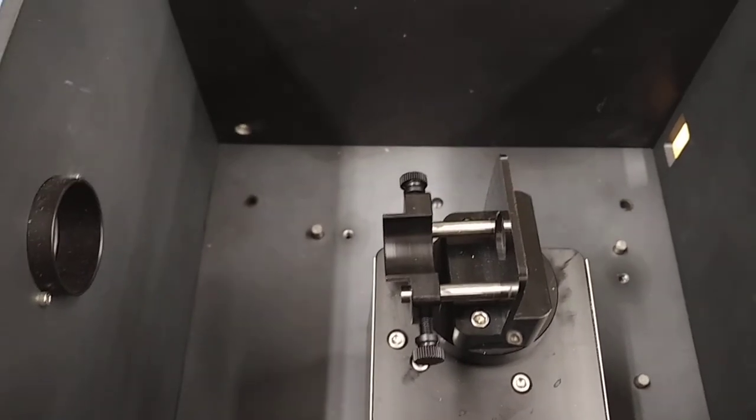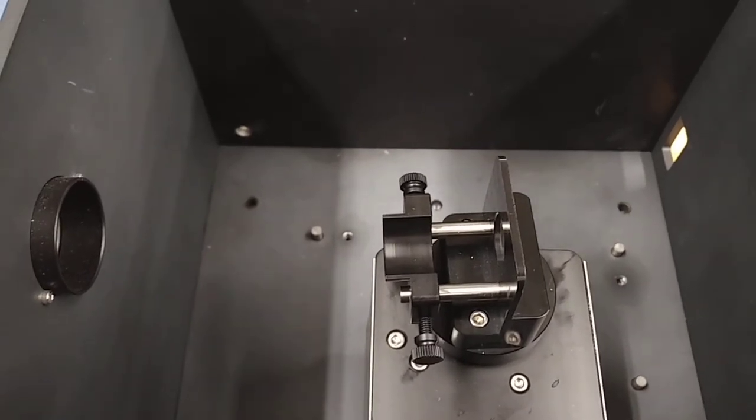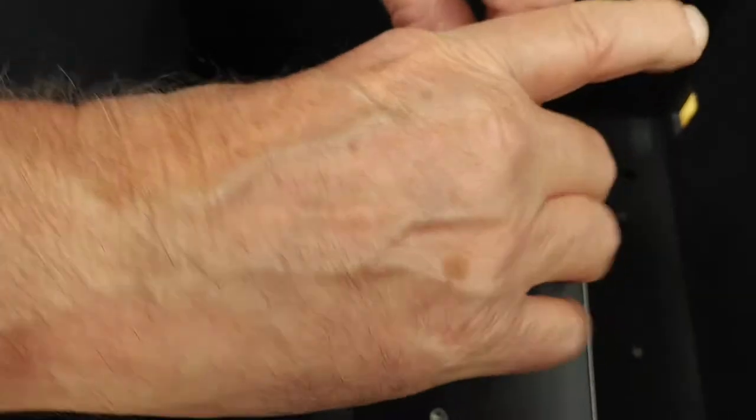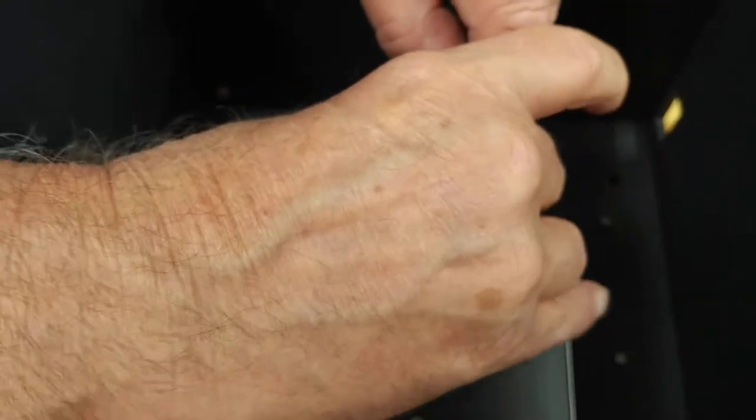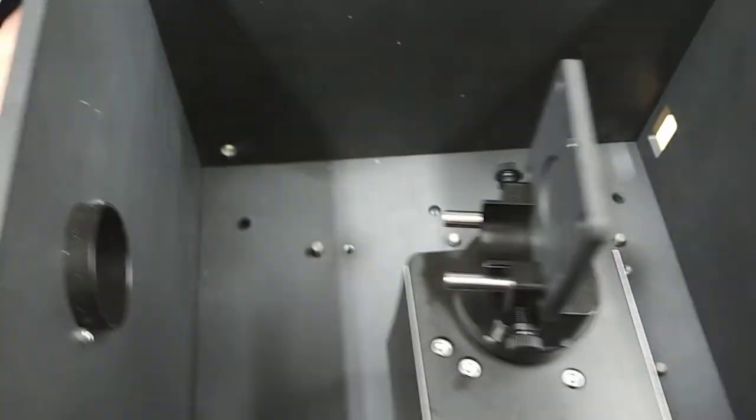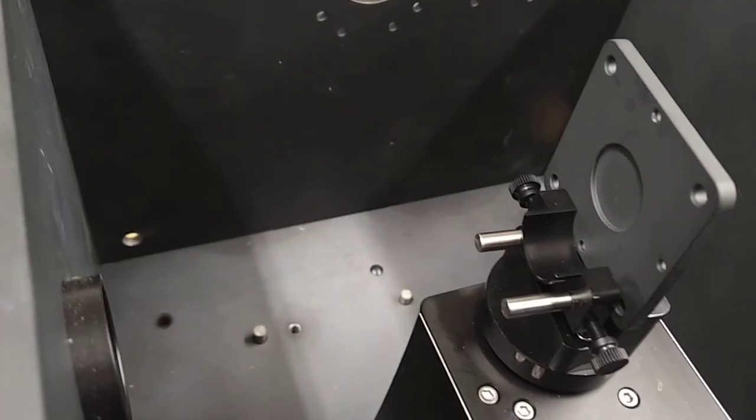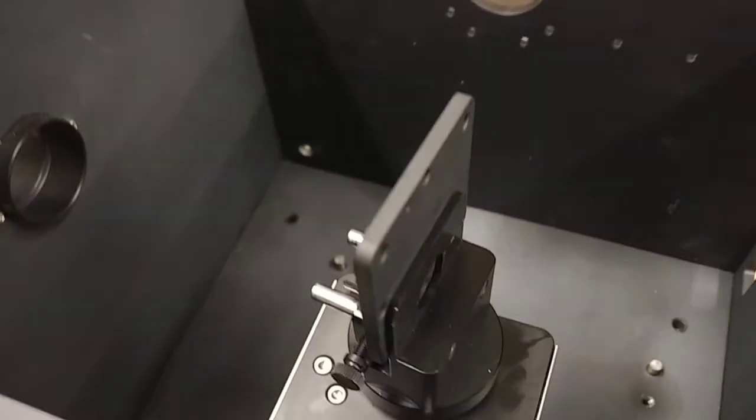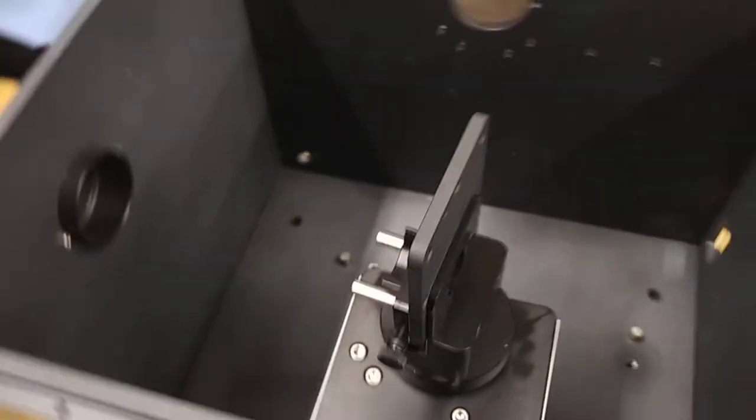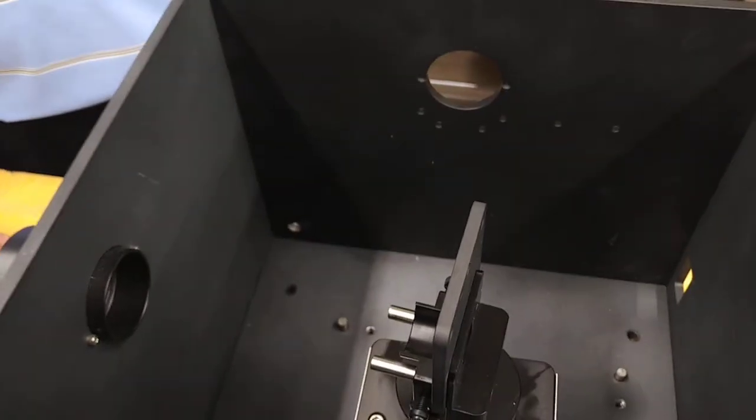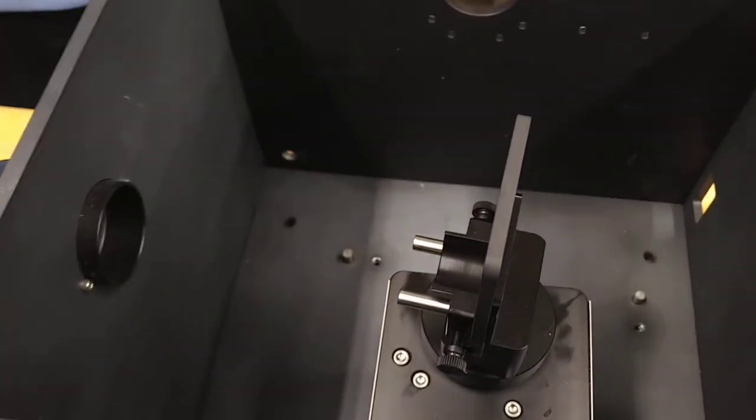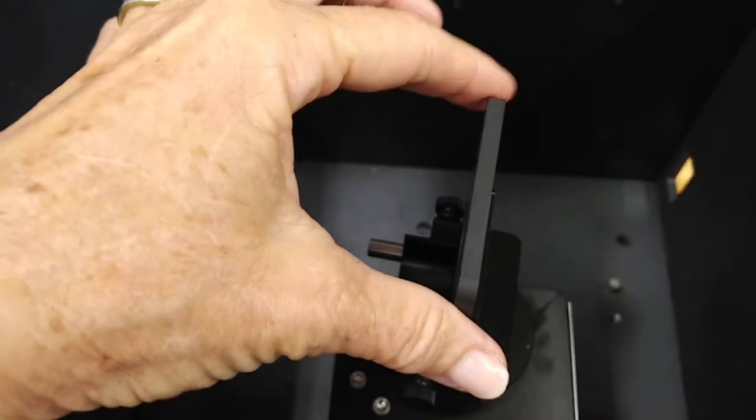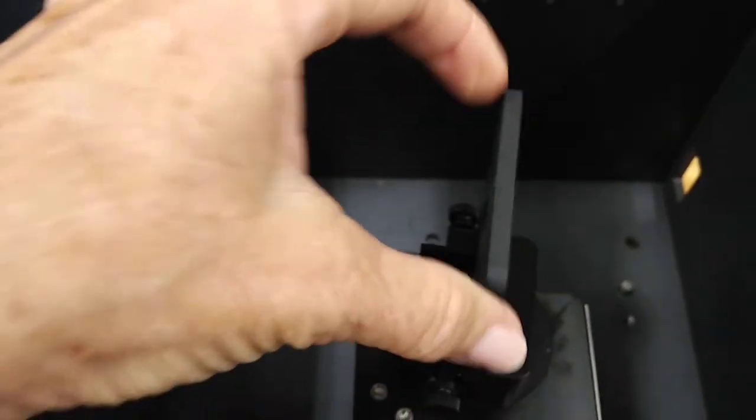All right, go ahead. That piece was roughly two inches square? Two inches square by about six millimeters thick. Okay, here we have a thinner piece that's taller. Obviously no tools are required to do this work, and lifting the sample out is quite straightforward.